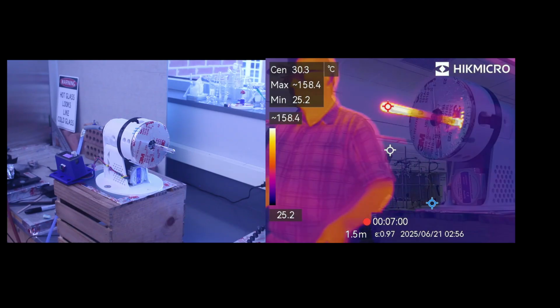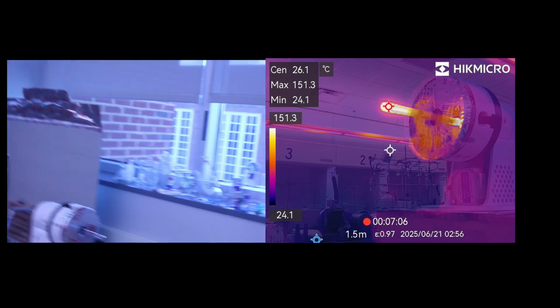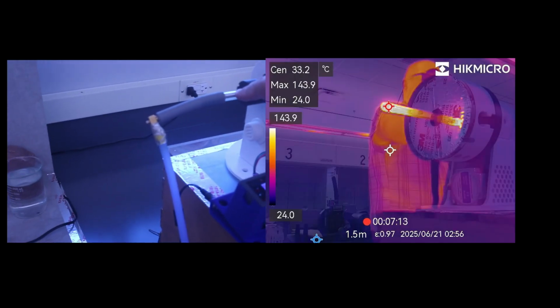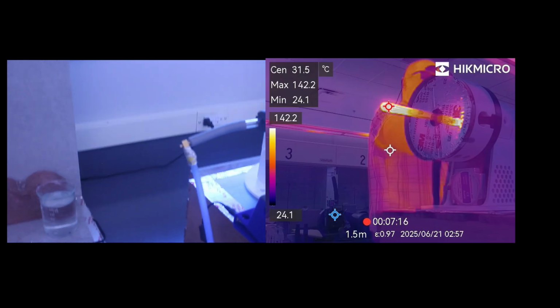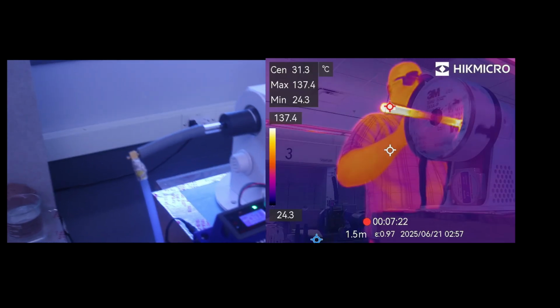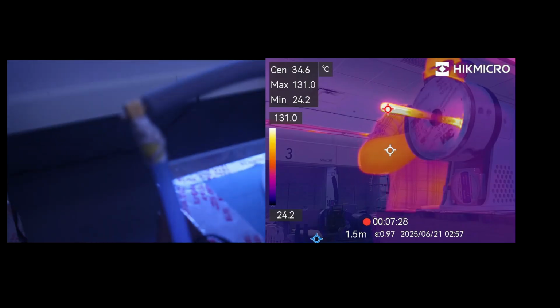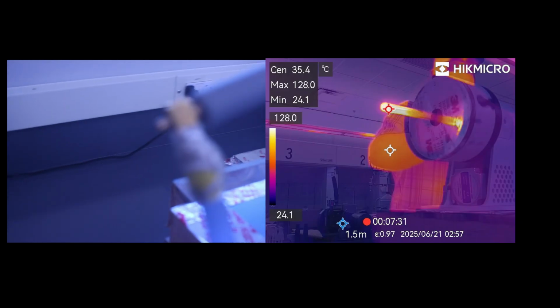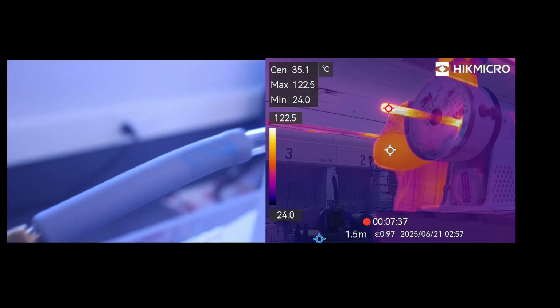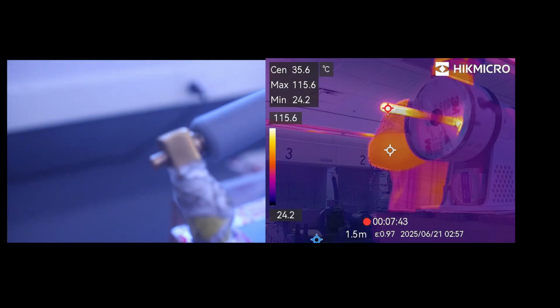All right, and come around back. So again, got my collet. Then my blow hose. The blow hose is on a swivel, and so that basically allows it to just freely rotate. There we go. In case you're wondering why the hose doesn't bind up, it's because, again, we've got this swivel.